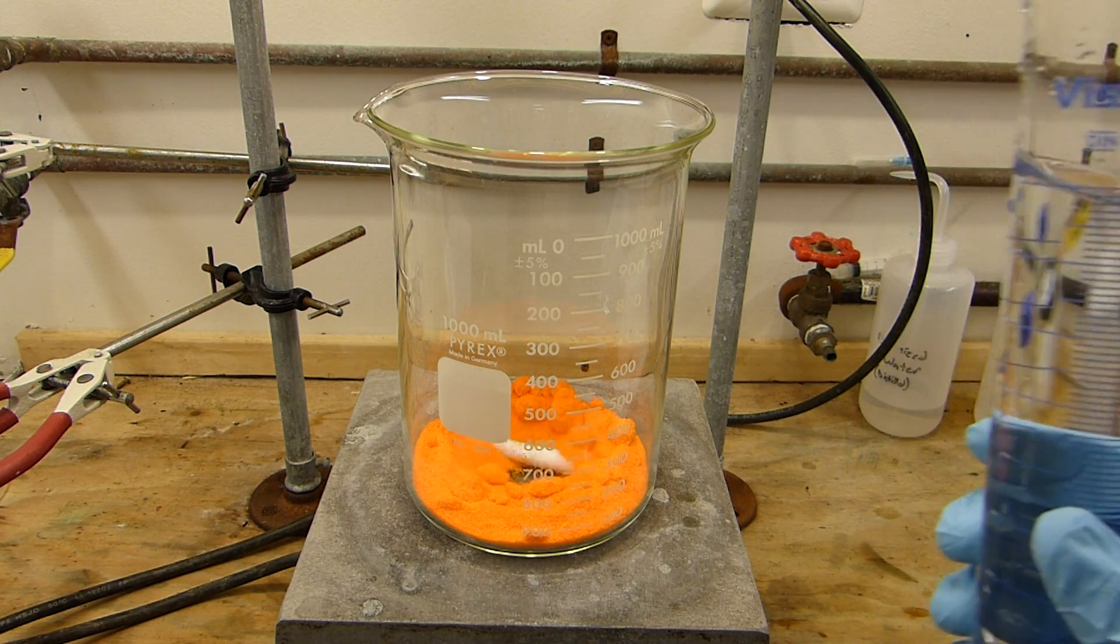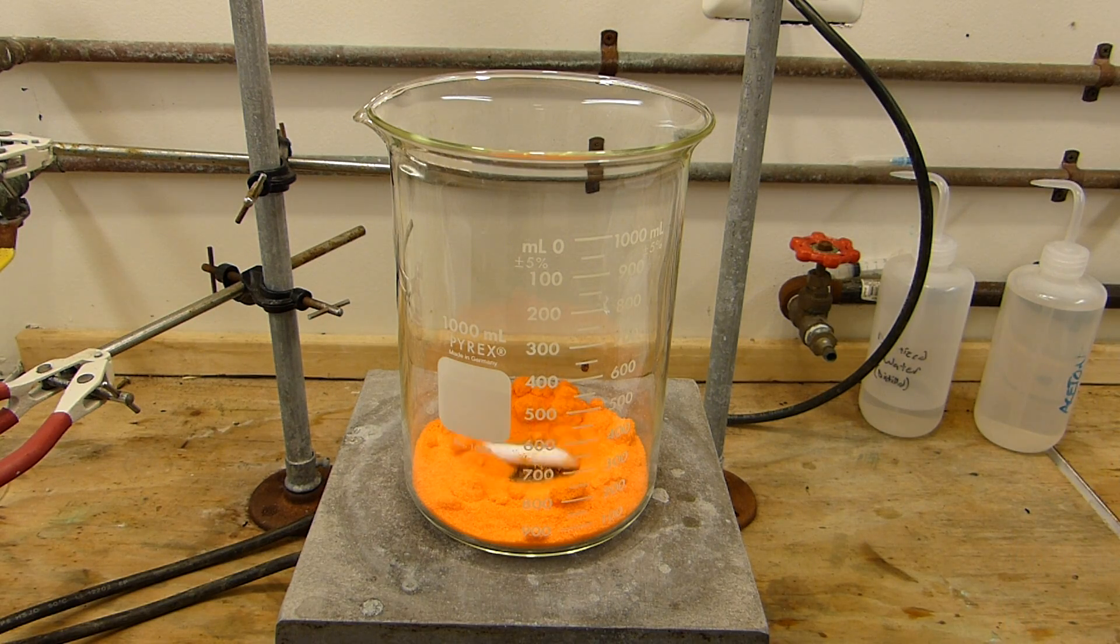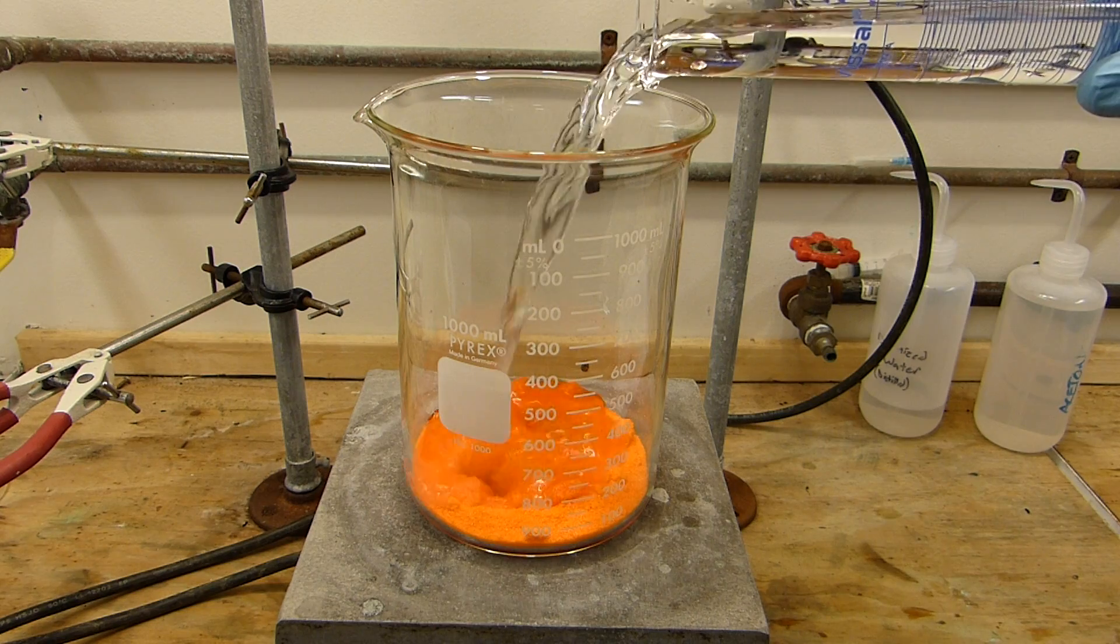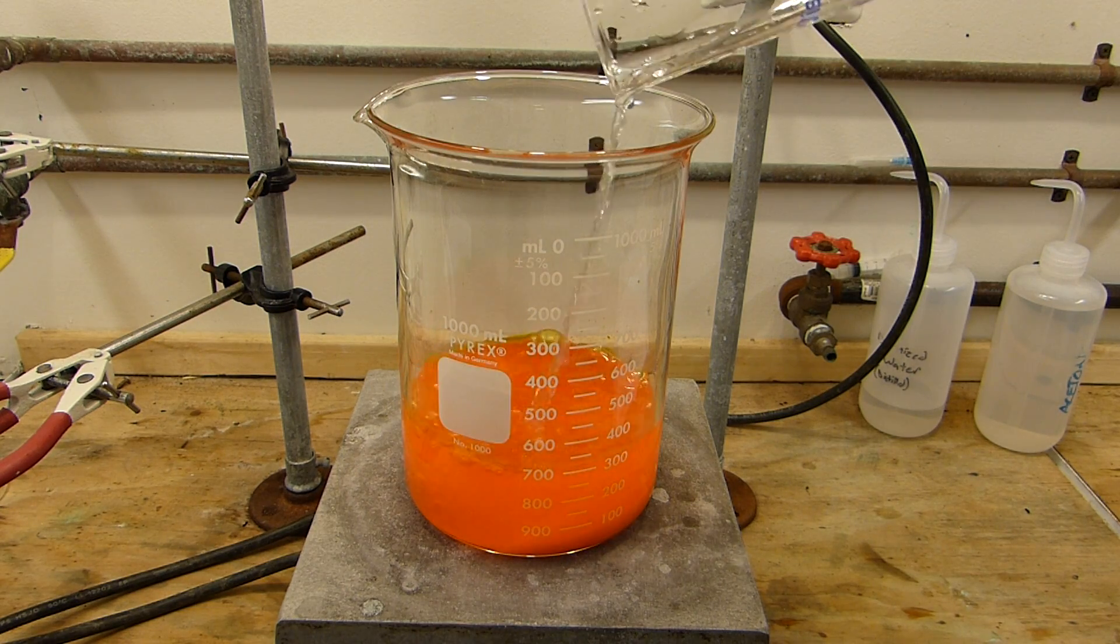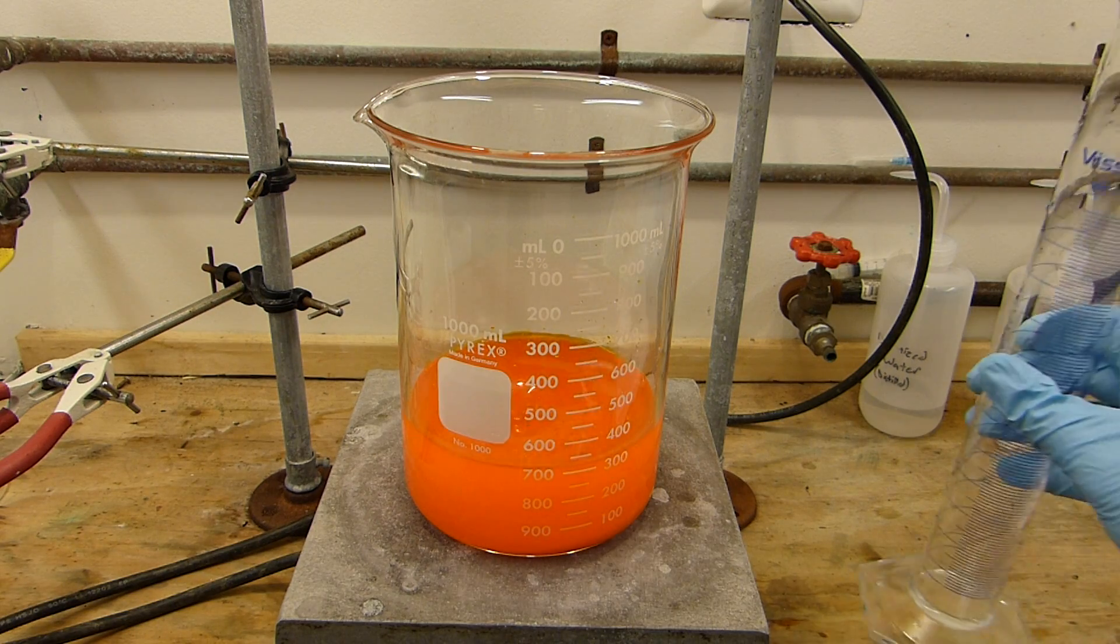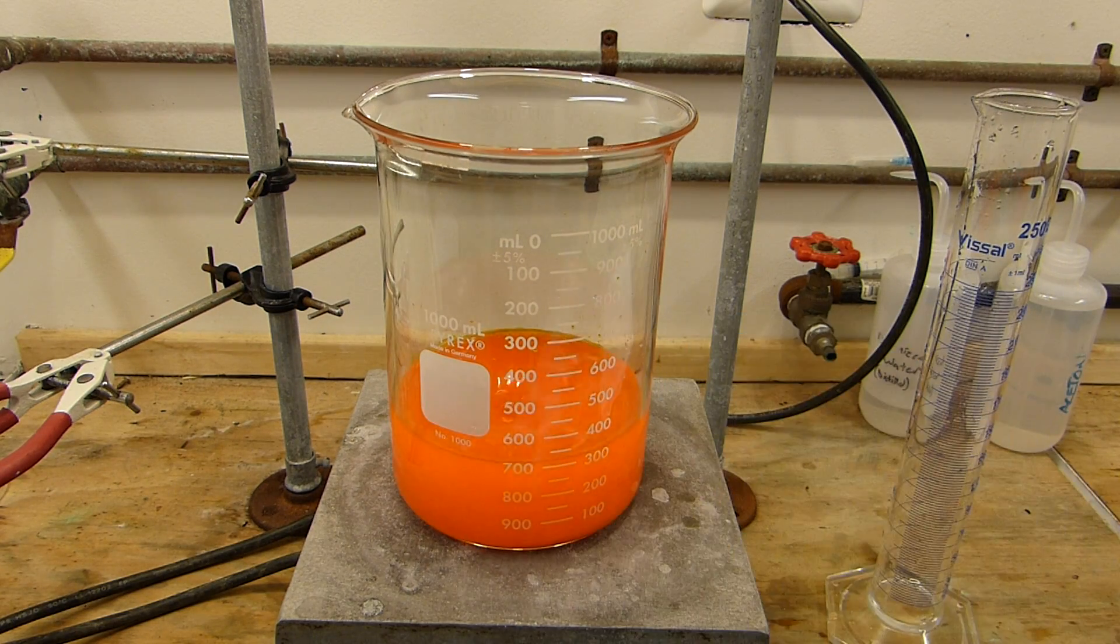I'm going to dissolve it in 250 milliliters of water so we're going to make that into a solution. Add that slowly and we're just going to stir this until it is completely dissolved.